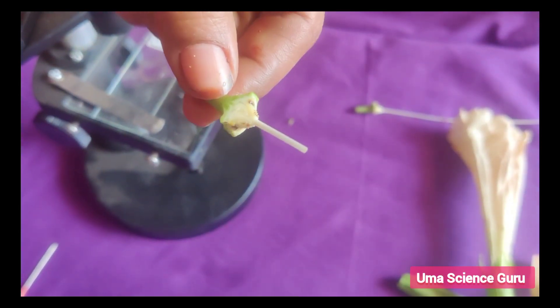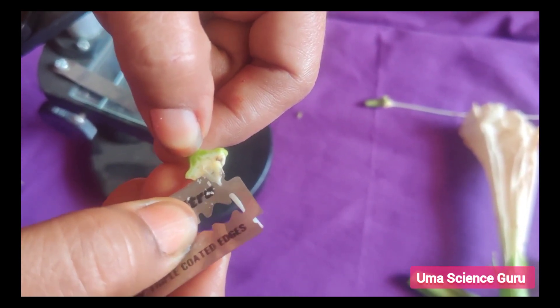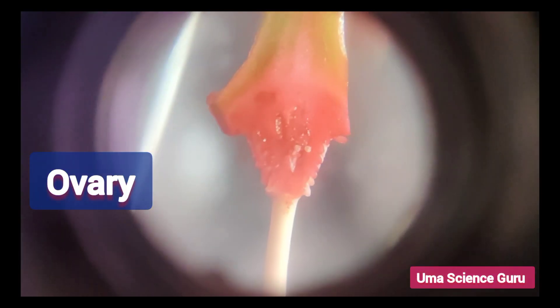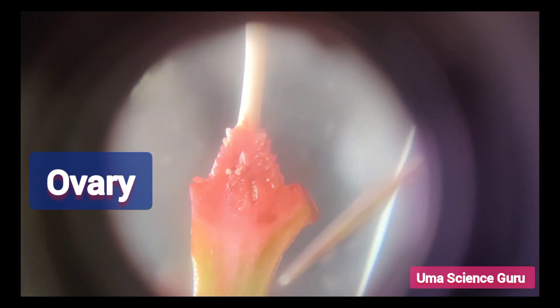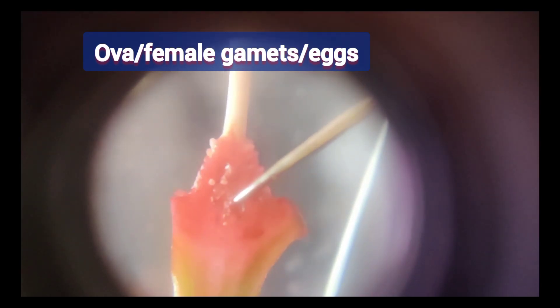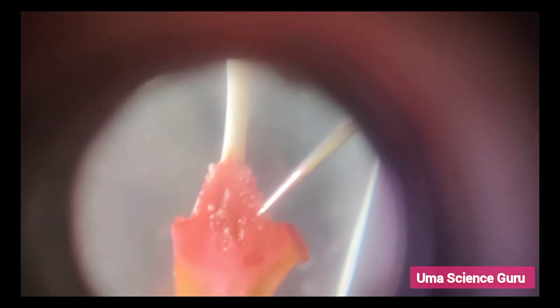Students, observe the stigma under the microscope. At the stigma you can see an ant as a pollinator. Now take a transverse section of the ovary and observe it under the microscope. You can see the female gametes or ovules under the microscope. I add some stain for a clear vision of the female gametes — round bulb-like structures, they are female gametes.